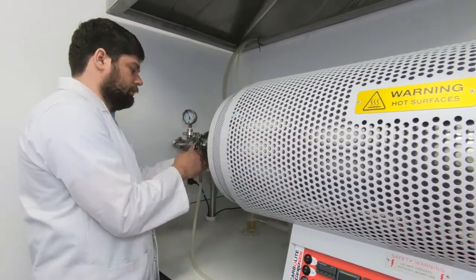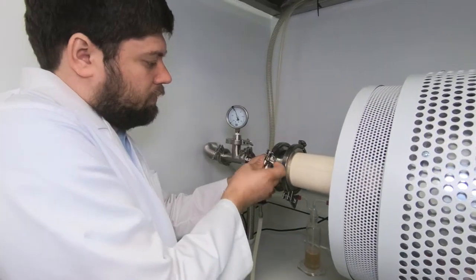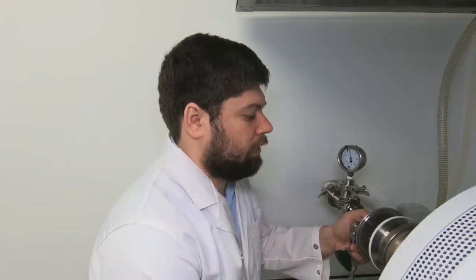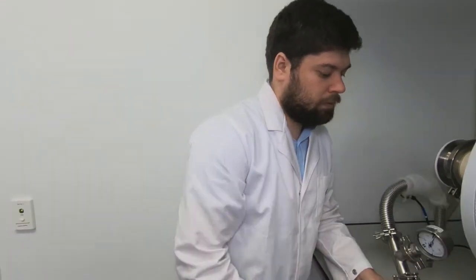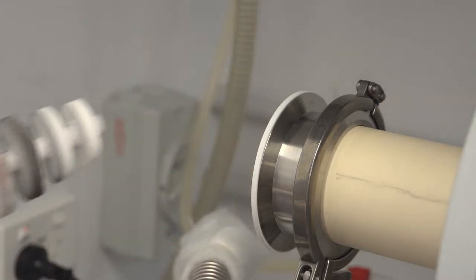And open it. First, I open this end, unscrew this part, take the end seal out, and take this radiation shield from the furnace.